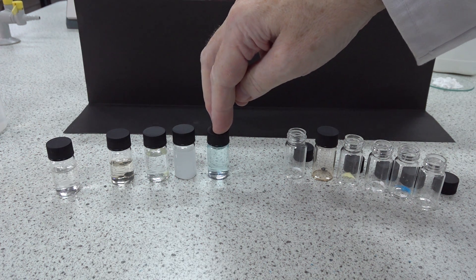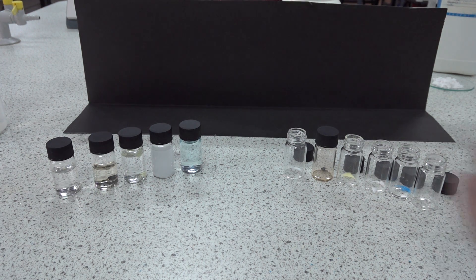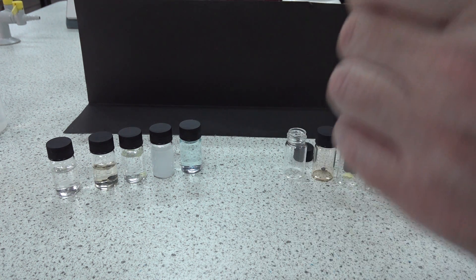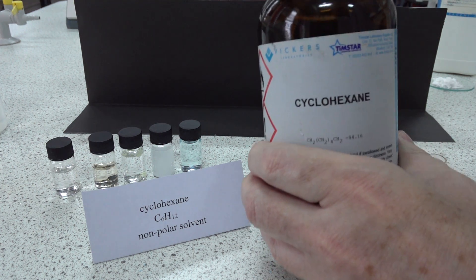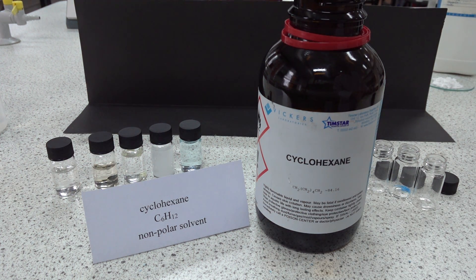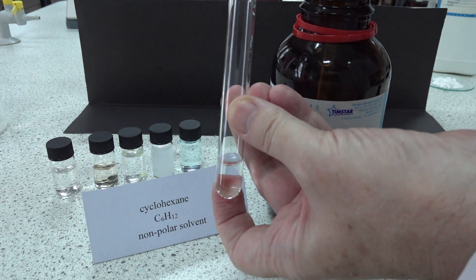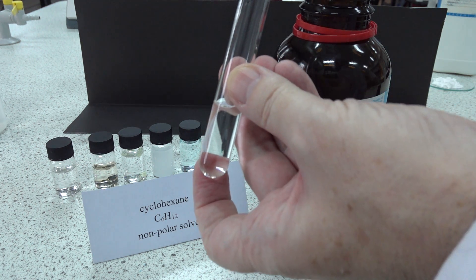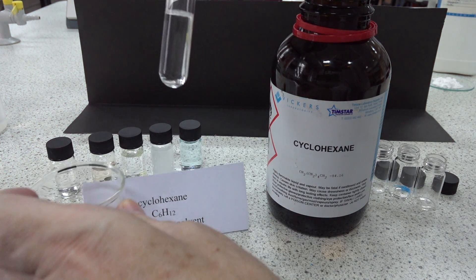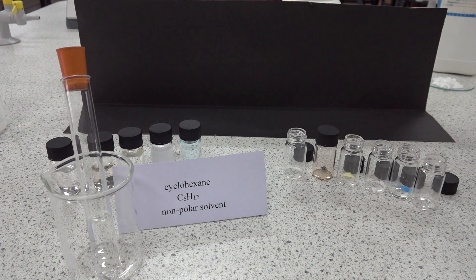So the solubility of our materials in water: sodium chloride and copper sulfate are soluble; iodine, sulfur, and calcium carbonate are insoluble. Our second solvent is cyclohexane - a so-called non-polar solvent, unlike water which is a polar solvent. It's a colorless liquid with a petrol-like organic smell.